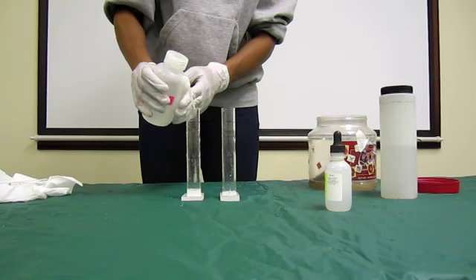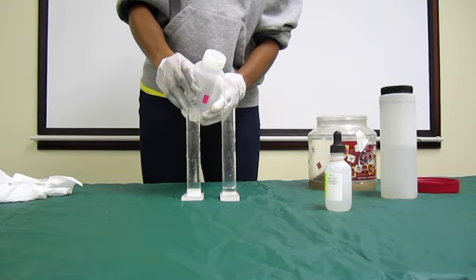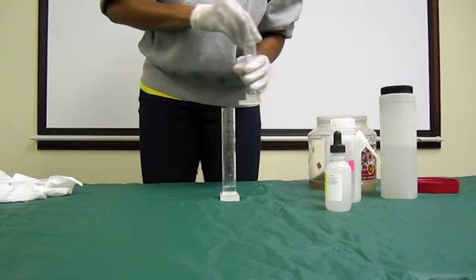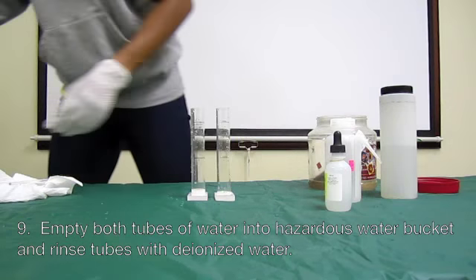For samples falling between dropper full, such as 1 and 2 droppers, you should assign a score of 7.5. That's 1.5 times 5. Empty both tubes of water into the hazardous water bucket and rinse tubes of deionized water.